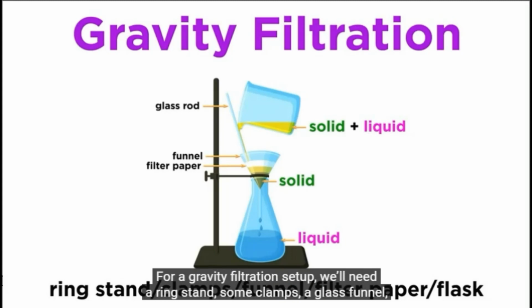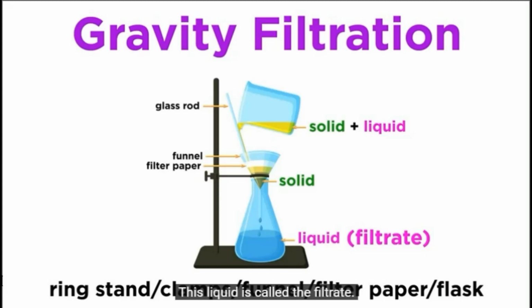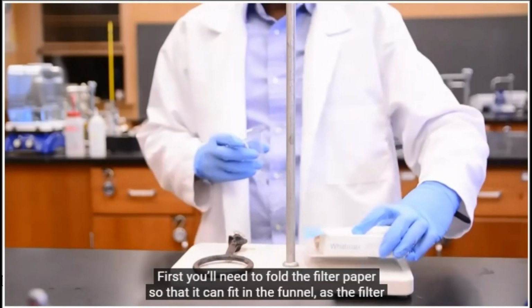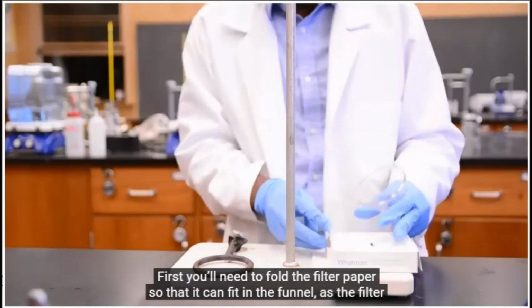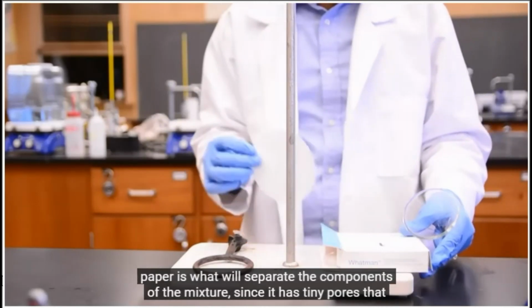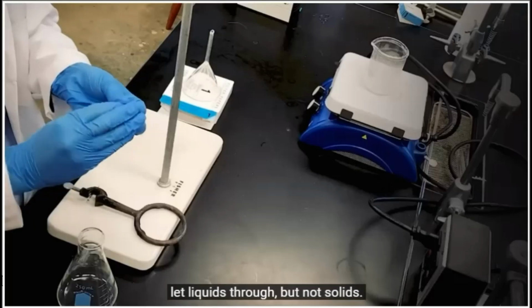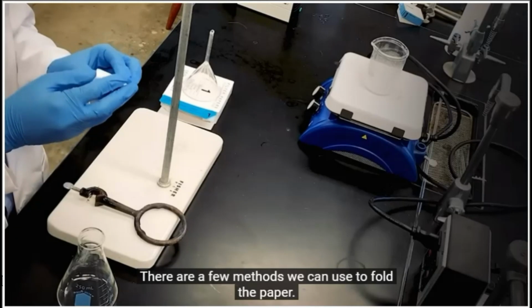For a gravity filtration setup, we'll need a ring stand, some clamps, a glass funnel, filter papers, and a clean flask or beaker to collect the filtered liquid. This liquid is called the filtrate. First, you'll need to fold the filter paper so that it can fit in the funnel, as the filter paper is what will separate the components of the mixture, since it has tiny pores that let liquids through, but not solids. There are a few methods we can use to fold the paper.